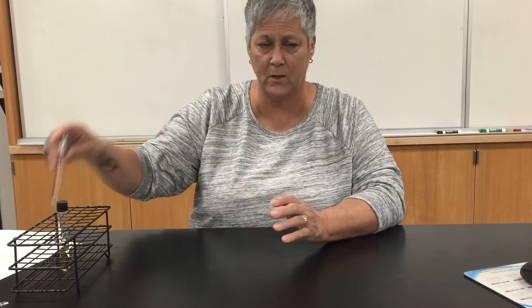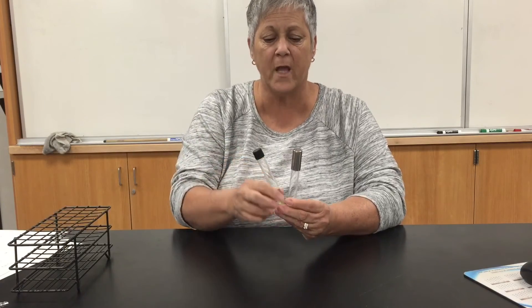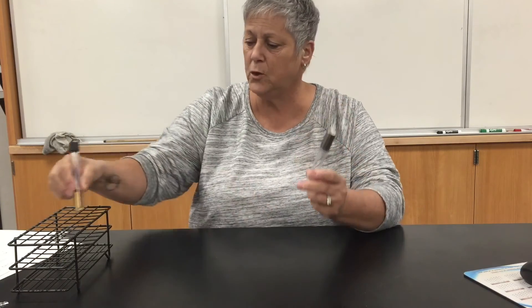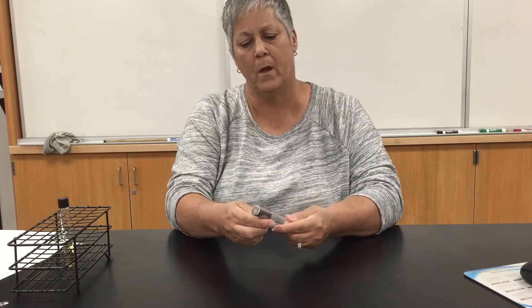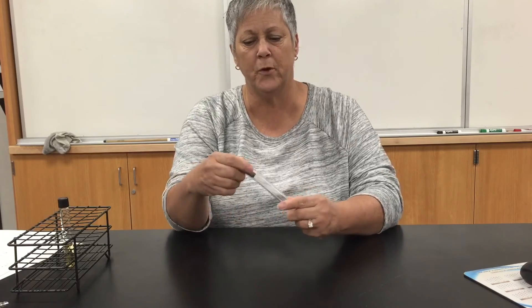When you're done with the test, everything is going to get boiled down for disposal, just like always. Even these tubes with the Morton caps — you'll see there are little holes cut into the Morton cap — just put the Morton cap on and boil it down for disposal like you would anything else.